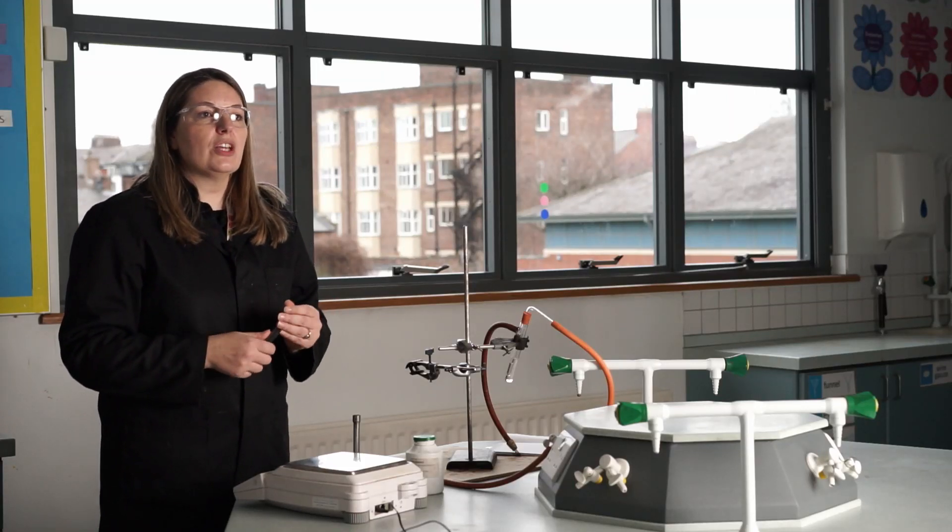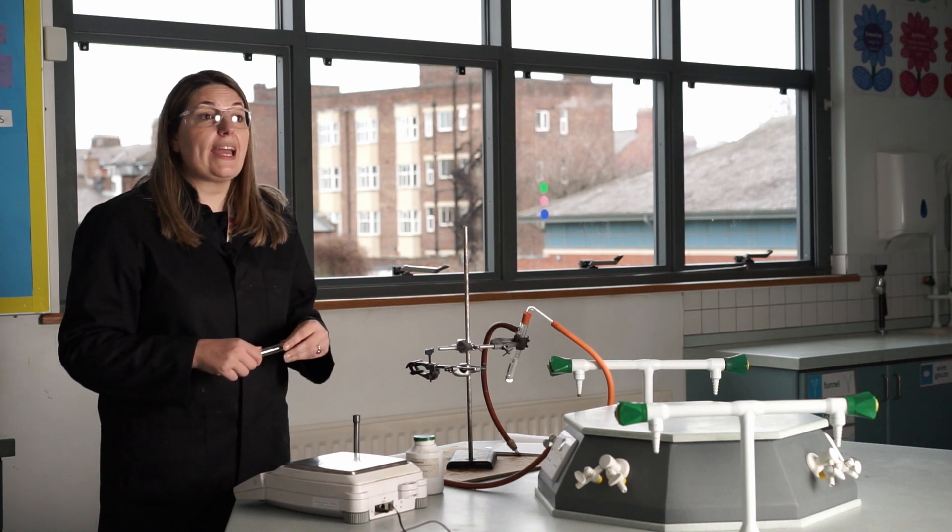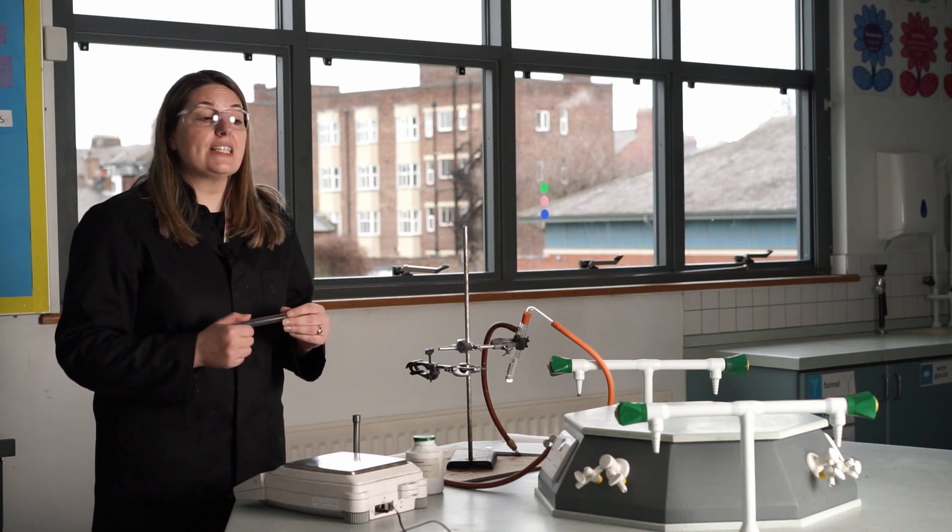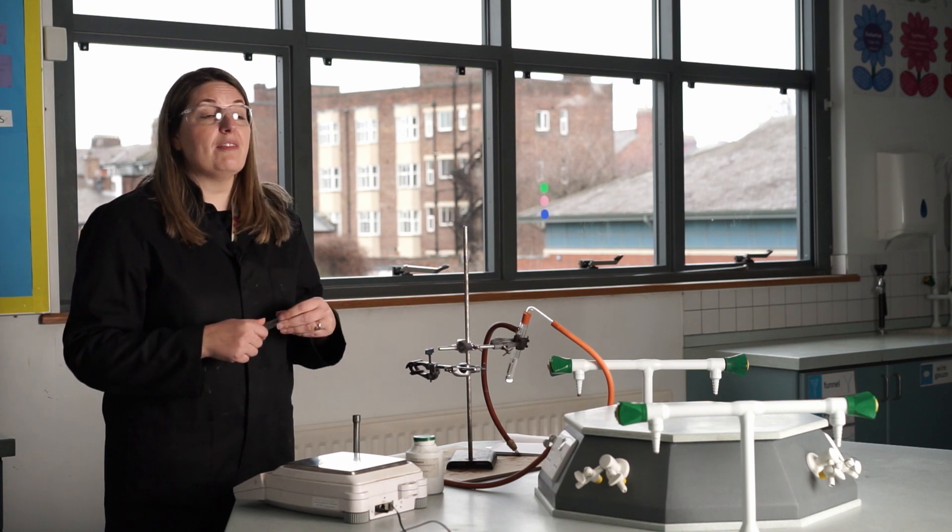Today's practical we're going to look at the reduction of copper oxide. So far when we've been working out empirical formulas, we have looked at the combustion of magnesium to work out the empirical formula of magnesium oxide.